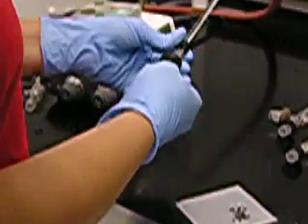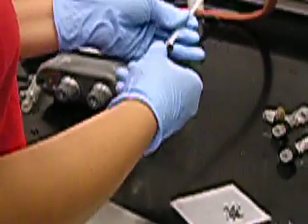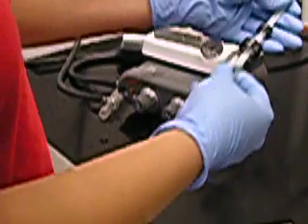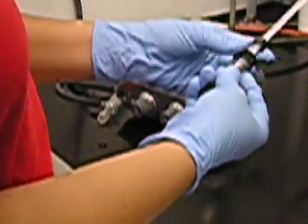All of our glassware should be put together pretty firmly, but not stuck. Next, we add a distillation head, again sliding it over the thermometer, and screwing it in place.